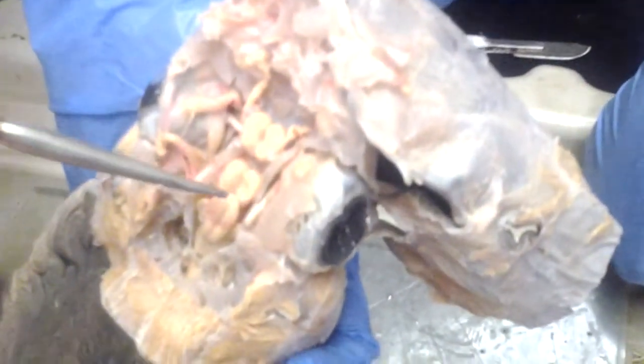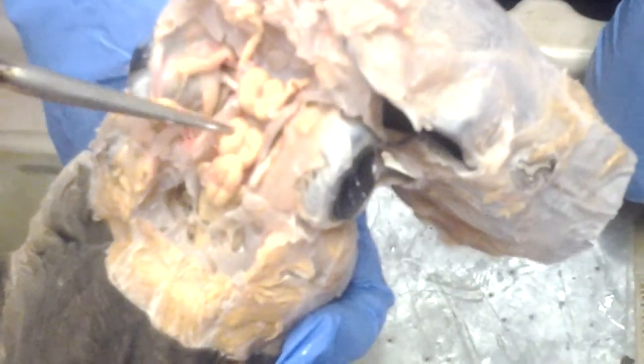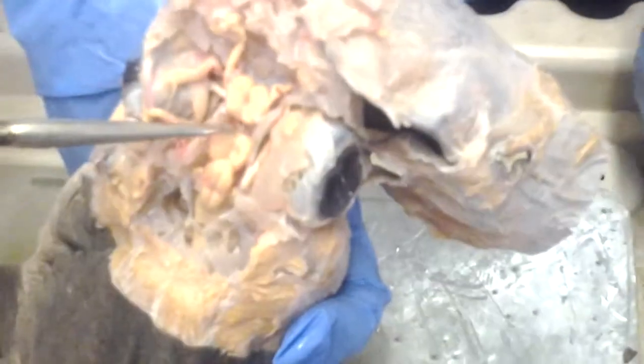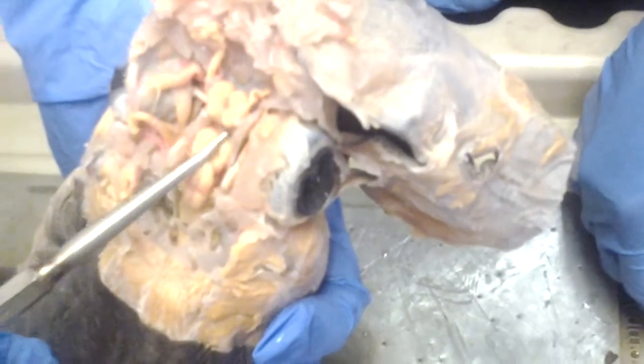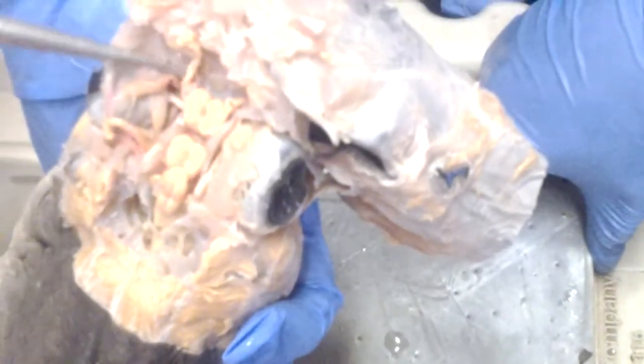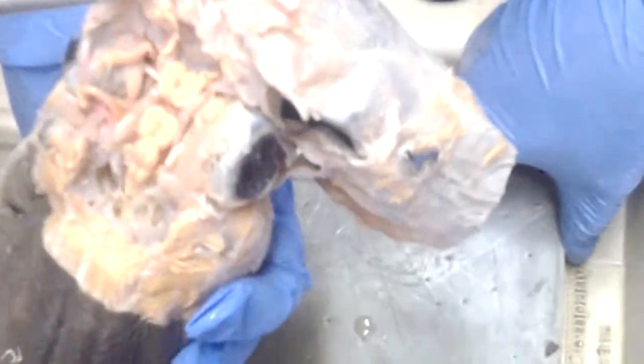Okay, so do you know what that is? Is that the cerebellum? Yeah, so cerebellum. Do you know what these are? Hemisphere? No. Optic lobes. So cerebellum, optic lobes, diencephalon. What is that? Cerebrum. The diencephalon is right in here with the telechoroidea. These are the cerebral hemispheres. This is the olfactory tract, olfactory bulb, and olfactory sac.